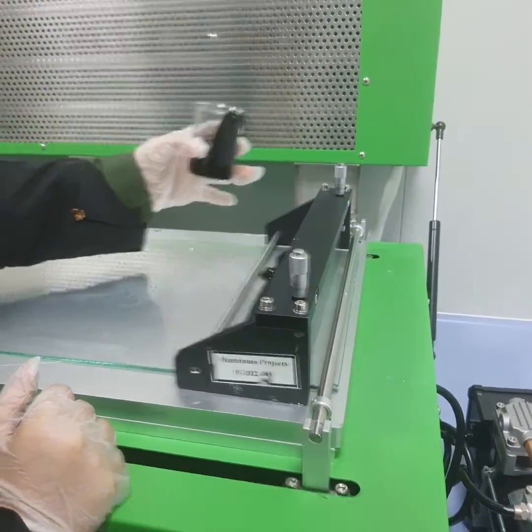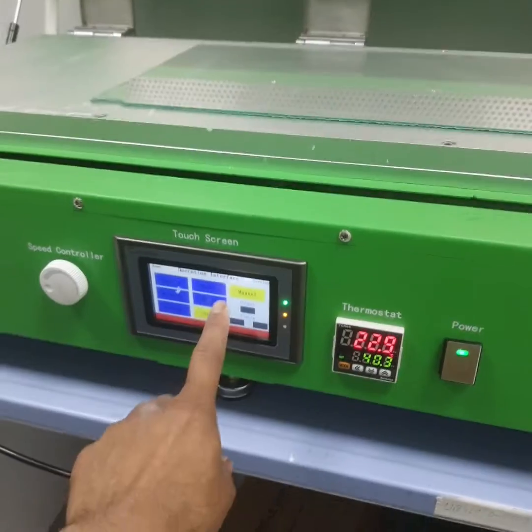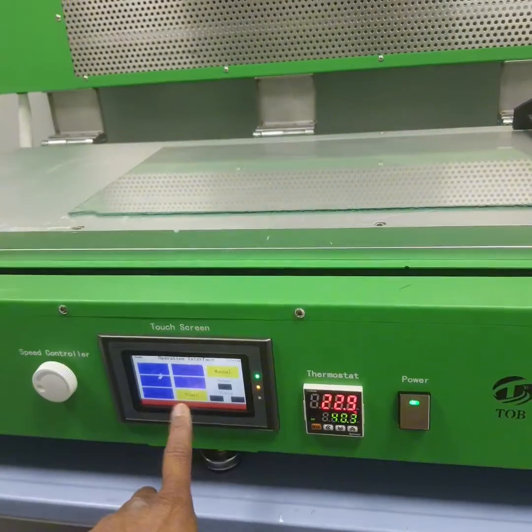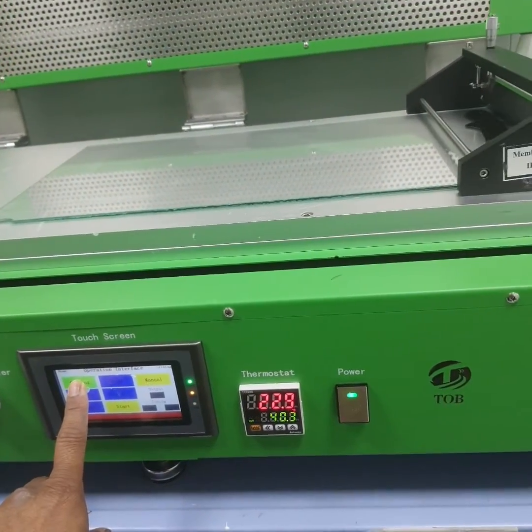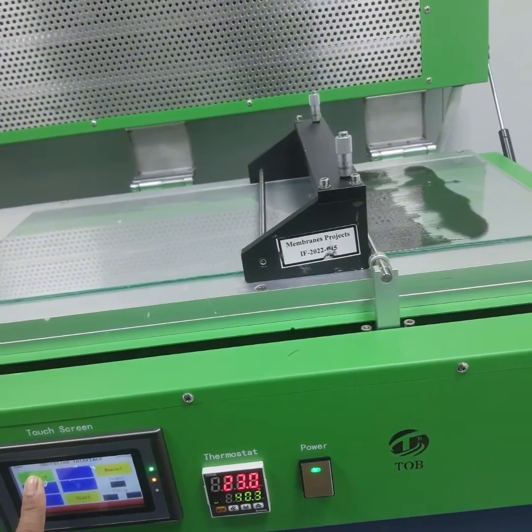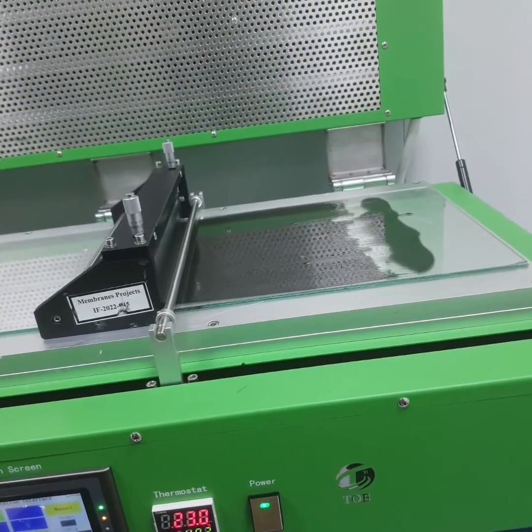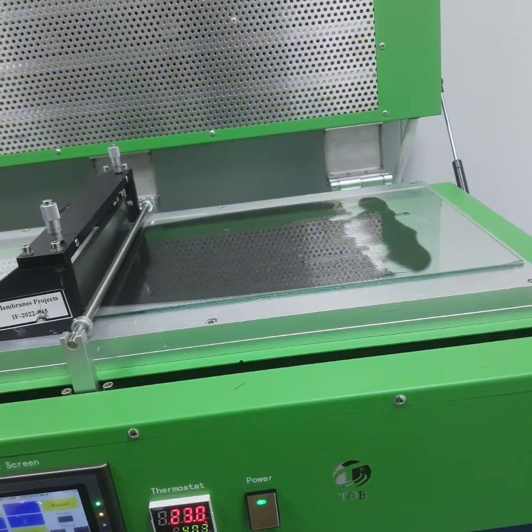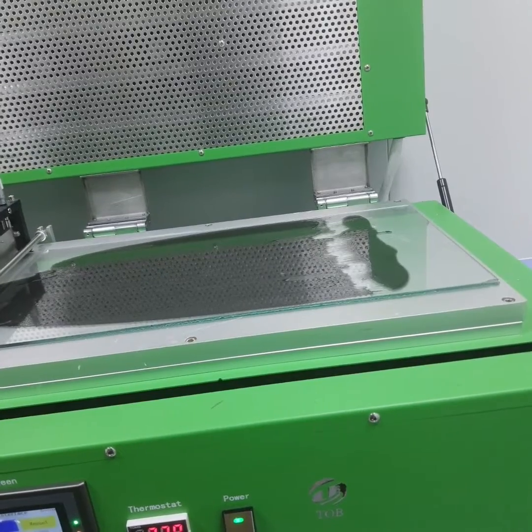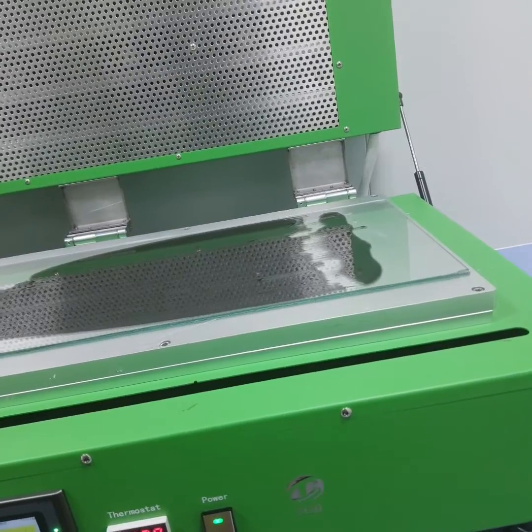Now what we need to do is, we have the coating, we have the reset, we have the heating vacuum. So usually what we do is coat. When we coat, you see, now it's spreading uniformly on the plate. Now what we need to do is remove the plate and put it in the bath.